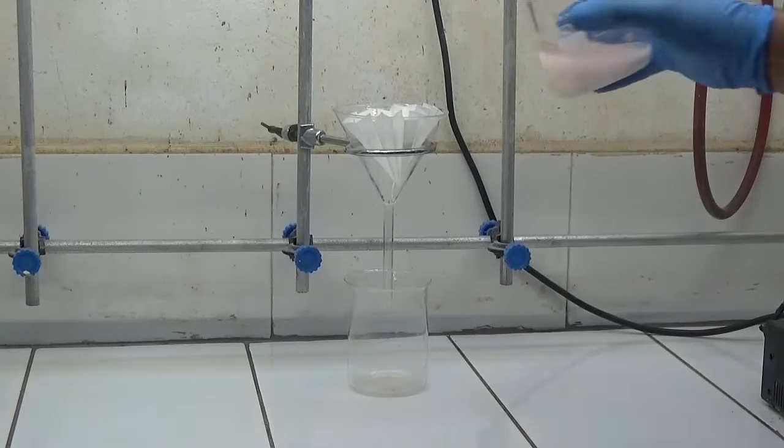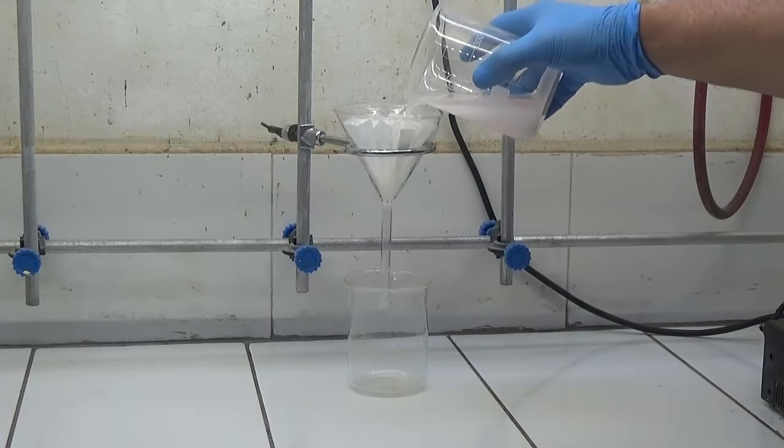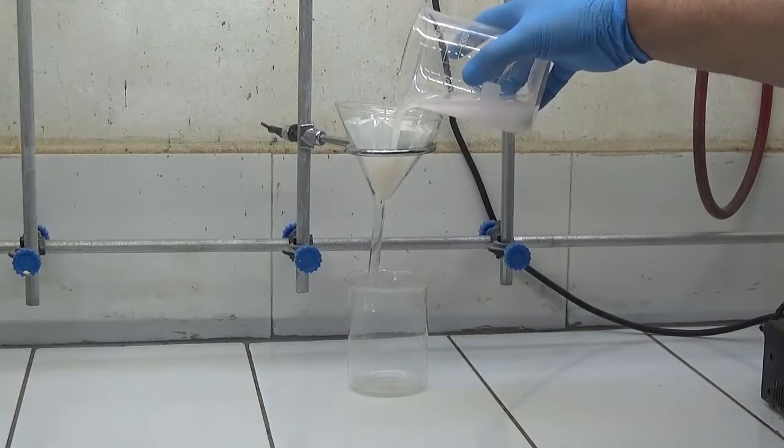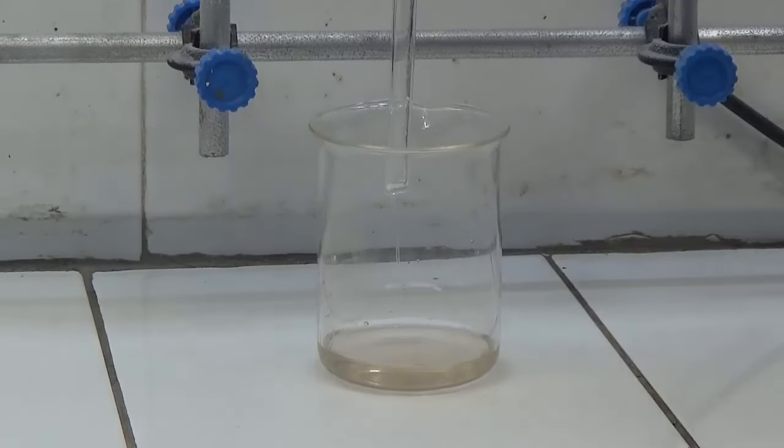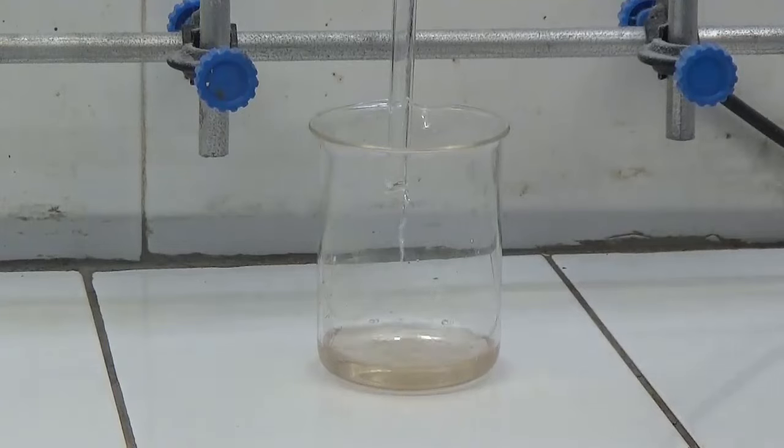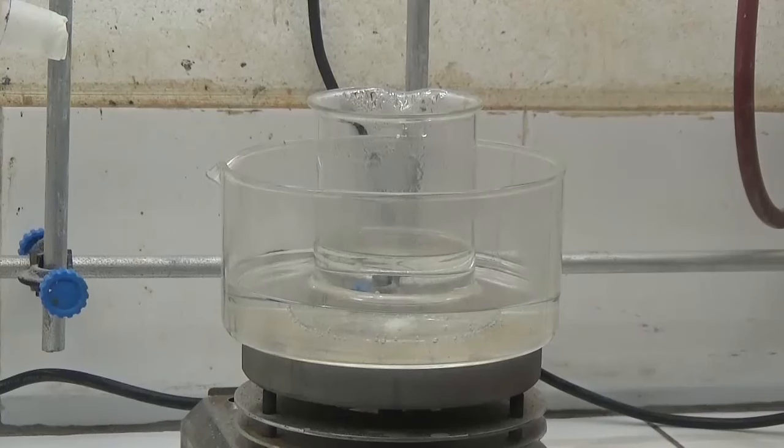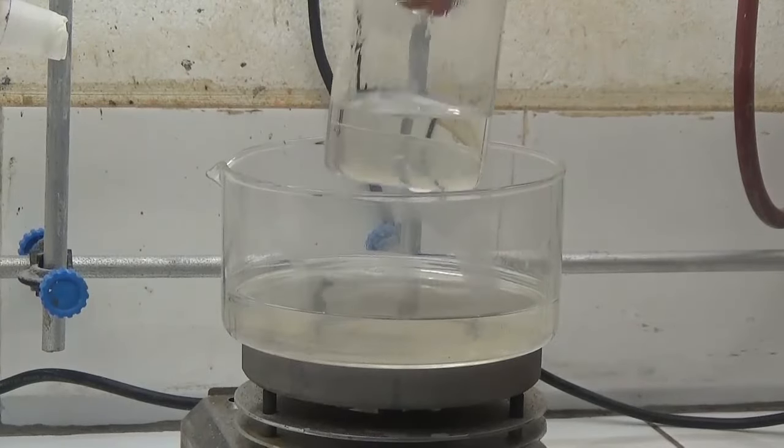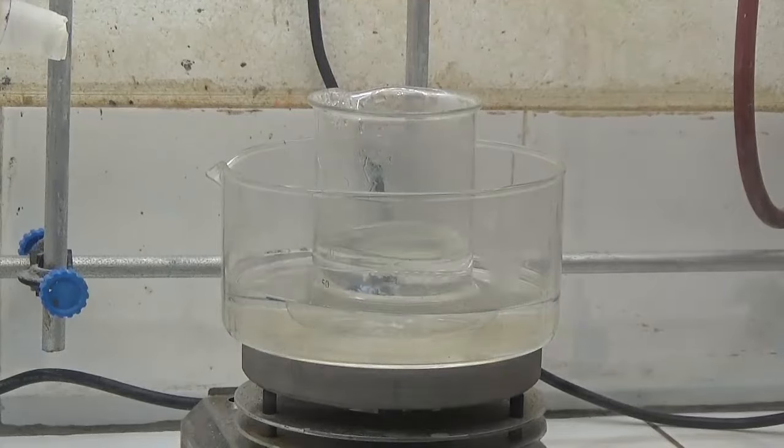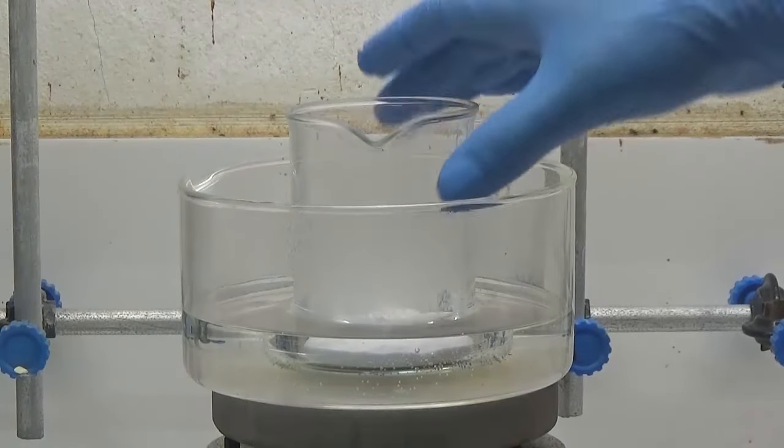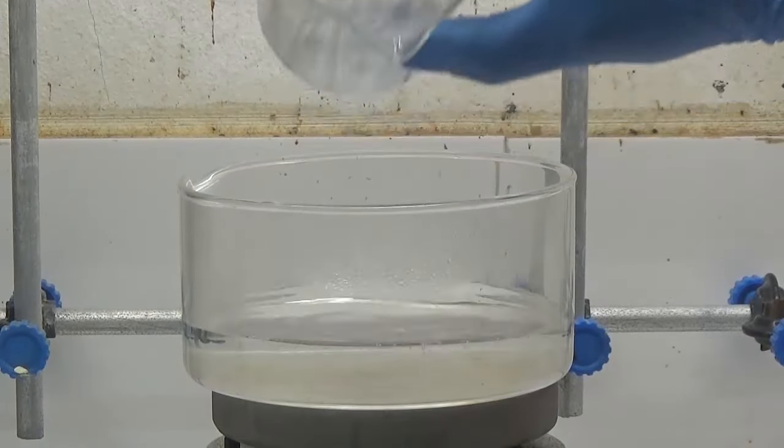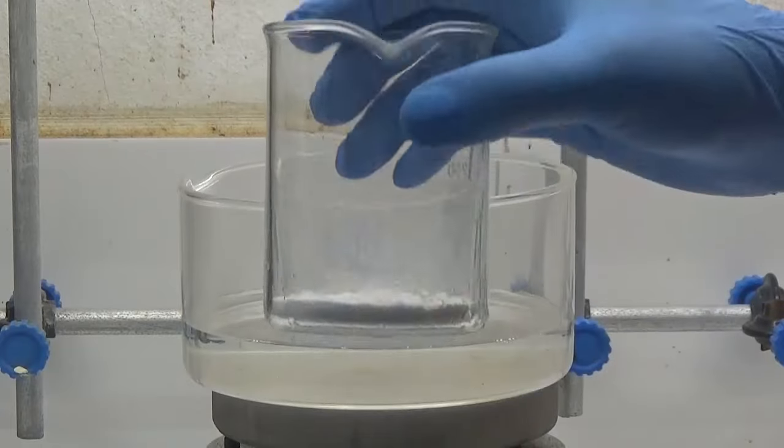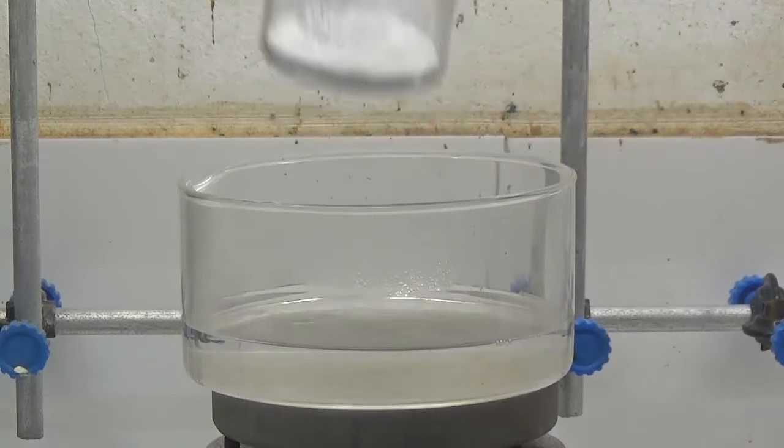Filter for removal of insoluble potassium chloride and wash the solid with an additional 100 milliliters of ethanol. Evaporate all the alcohol in a warm water bath. The salt obtained consists in large part of barium thiocyanate.